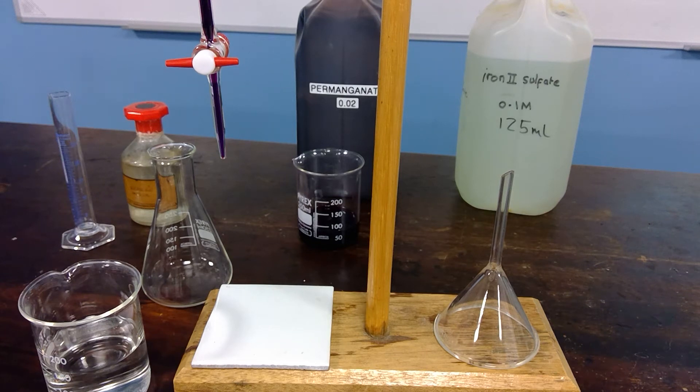This is a video to look at the use of potassium manganate 7, commonly known as potassium permanganate, as an oxidizing agent in what is called a redox titration. It links with the practical redox 1 determination of the iron content in lawnsand, often done at rugby school.